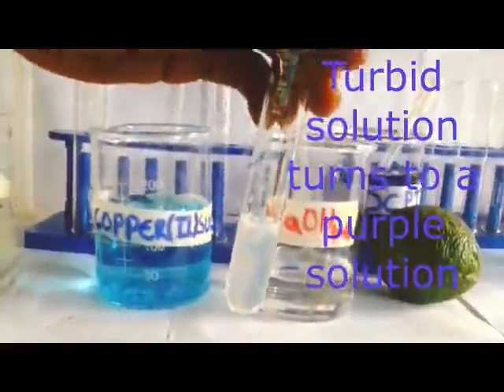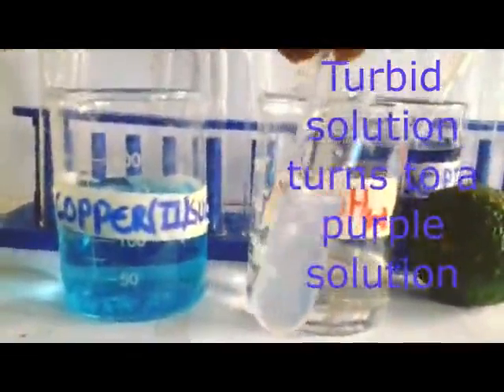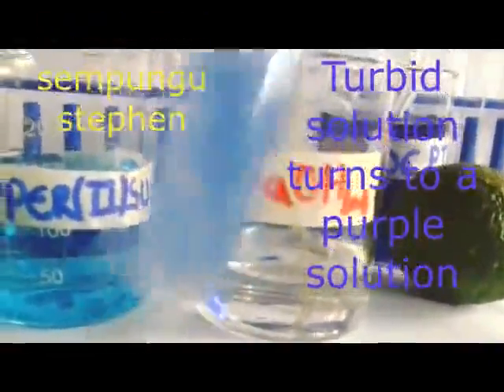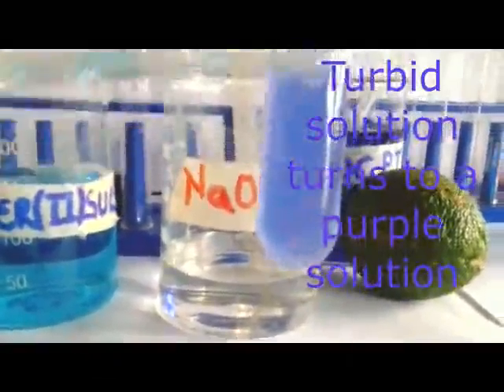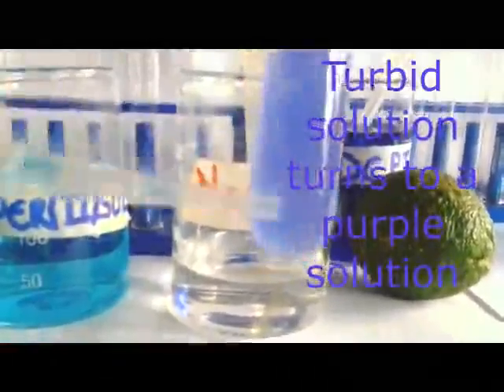Now I put my first drop. I can do some shaking, and you can see there is some color which is beginning to come there, some strange color. Then I add more, then I shake. Now when I shake, members, you can see what we are getting. This one is what we are calling purple. That is the purple solution now.